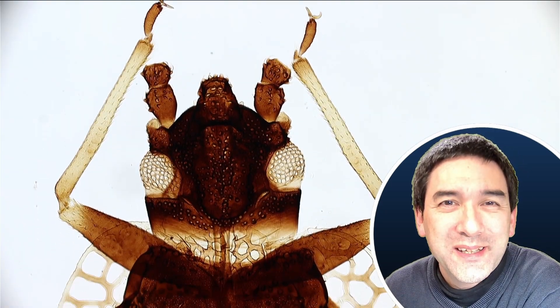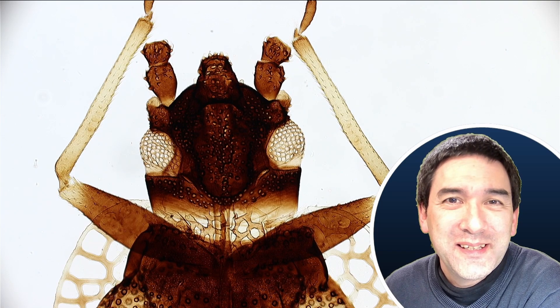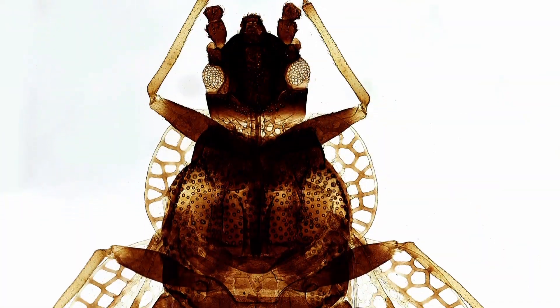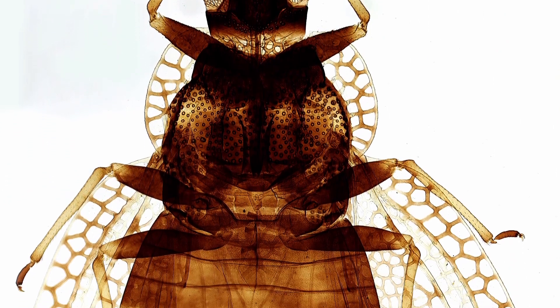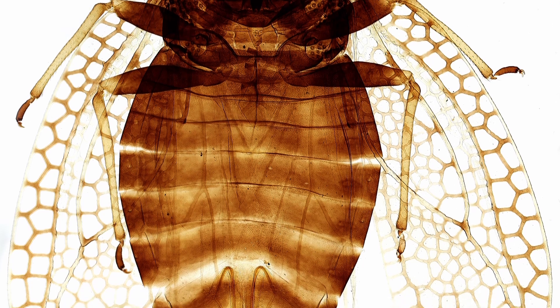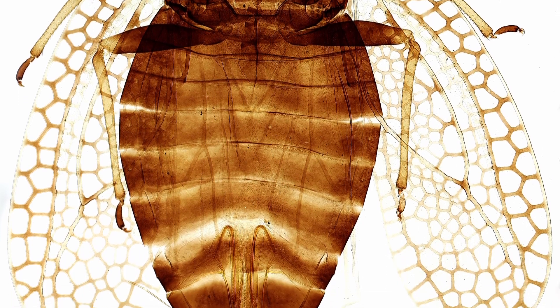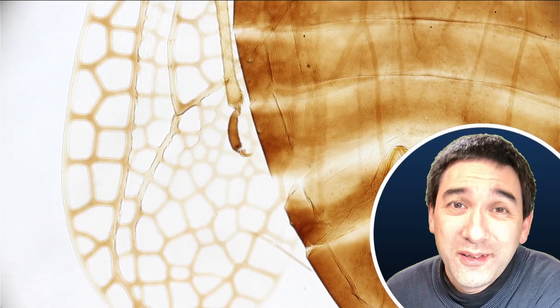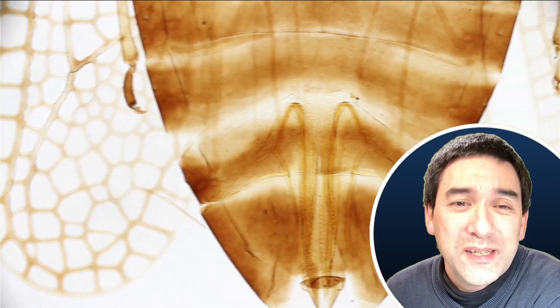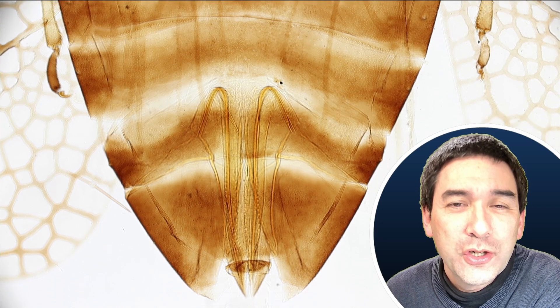Isn't this a great specimen? Look at the nice looking head. And very interesting is the pattern of the wings — the wings have this typical net-like pattern. There are of course insects that have this type of wing pattern, but there are around five to six thousand species of those, and I was not able to identify which insect it is.